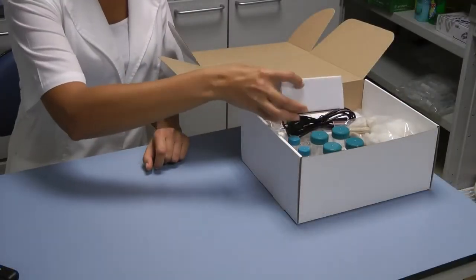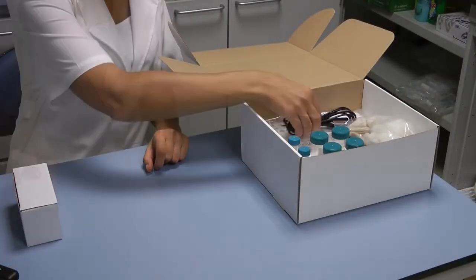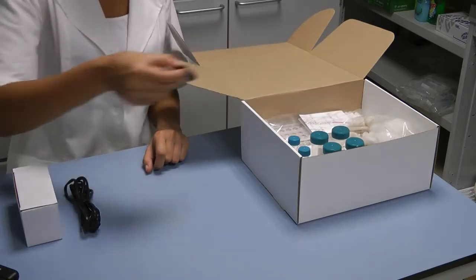To begin with, open the box and carefully take out all the parts necessary for testing with the device.